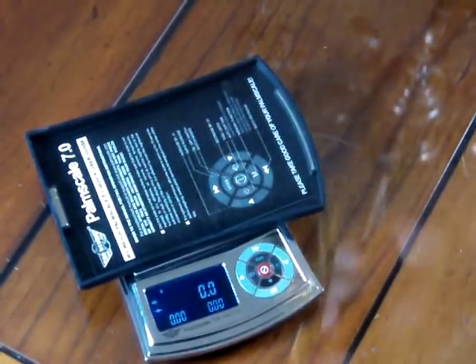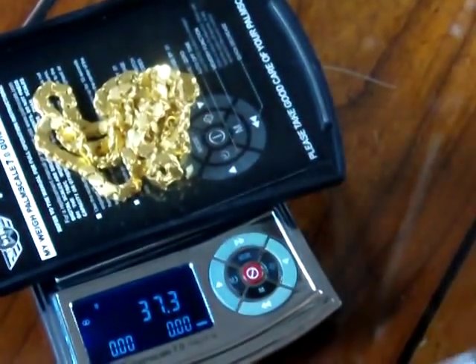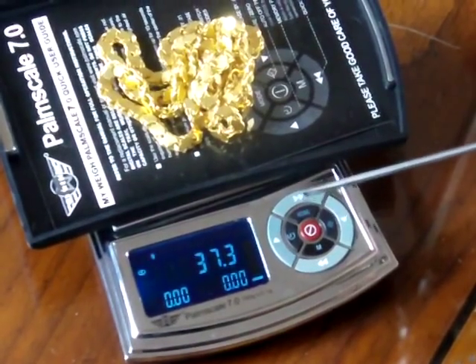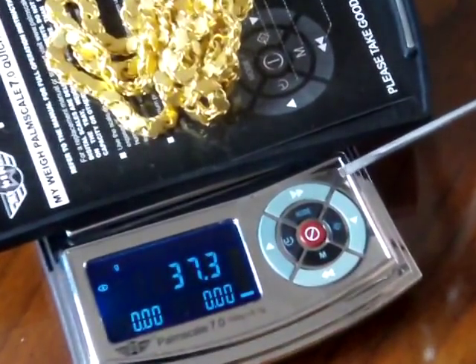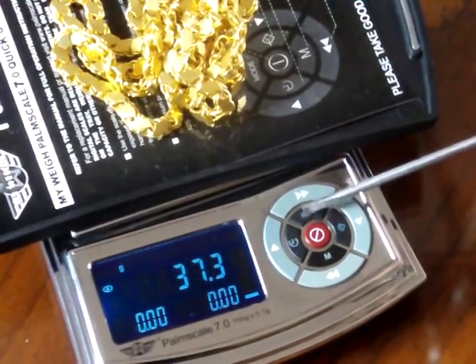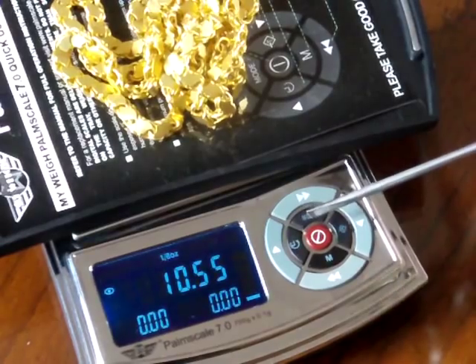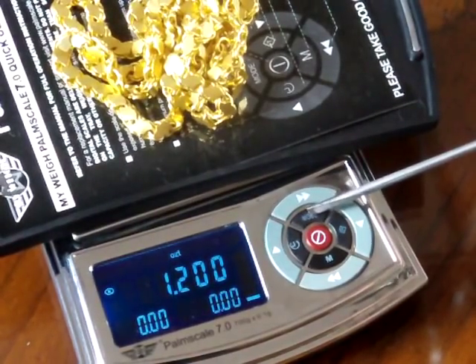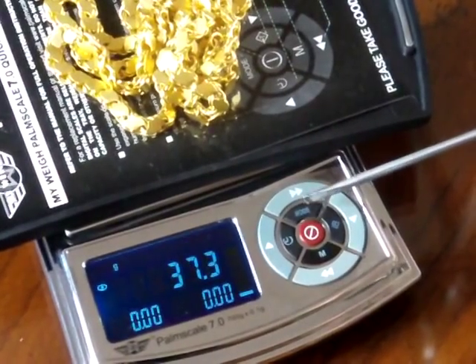The scale also has seven weigh modes. In the top left-hand corner it says 'G' — that's grams. If I press the weigh mode button — there are two circles here; the outer circle has to do with the price, the inner circle has to do with the functions — if I press the mode key, we have grams. Press it again: quarter ounces. Press it again: eighth ounces. Press it again: ounces. Then troy ounces, carats, penny weight, and we're back to grams.